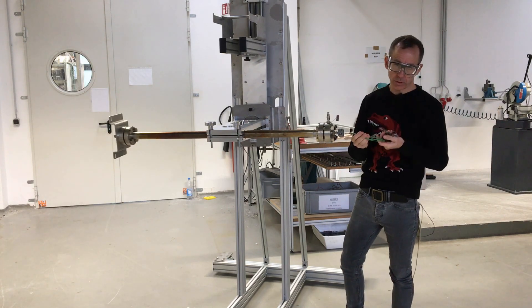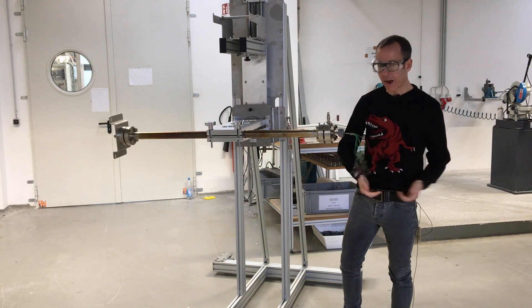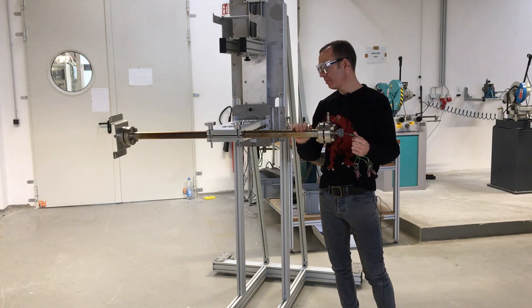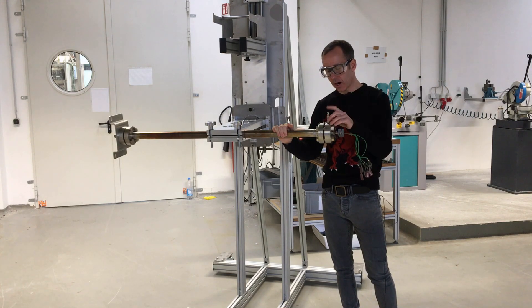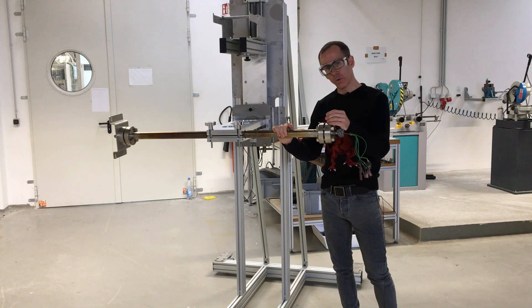Then remove a multi-point thermocouple at the bottom, pull the holding out with the frit, blow it clean, scrub it clean with a metal brush afterwards, and remount the flanges. We use VCR or VCO type connectors at the bottom, which are the ones that are opened and closed to actually remove and insert the reactor.